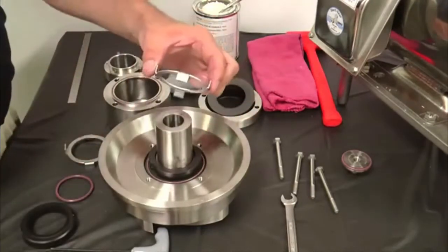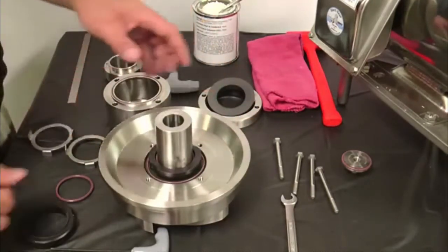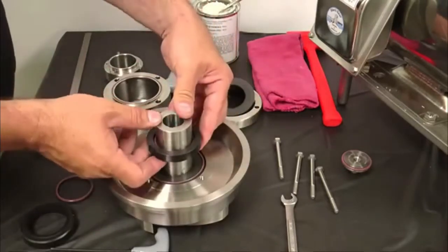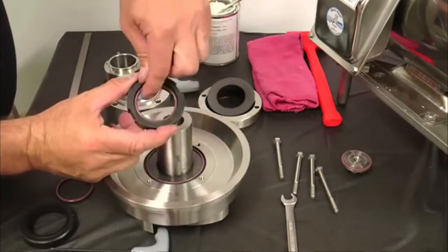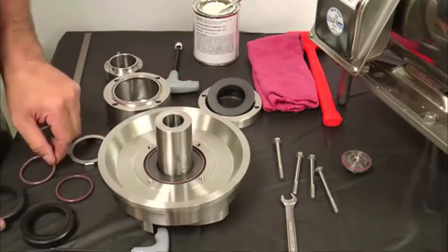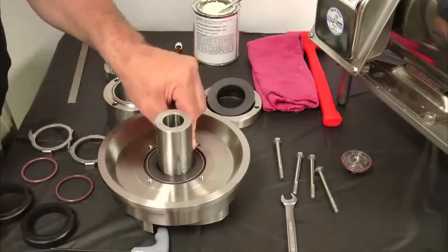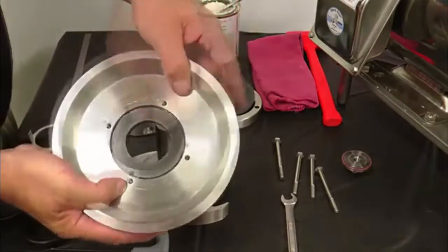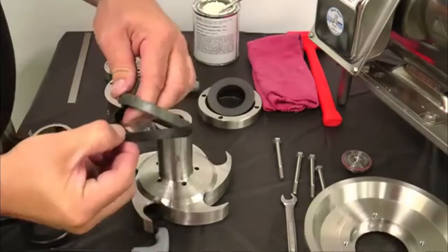Use the back plate to slide the rotary seal up the impeller shaft approximately 1.5 inches. Remove the rotating seal and rotating seal O-ring. Remove the flush housing O-ring if it was left behind when the flush housing was removed. Lift the back plate and remove the stationary seal and L-gasket from the back plate.